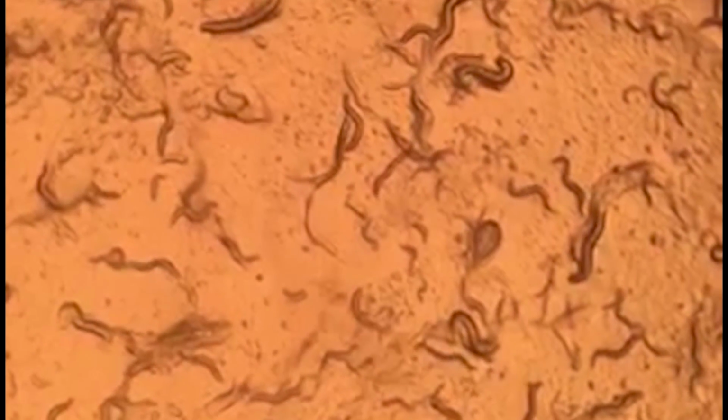Right here, you can see the dumpy mutation is a close, non-fatal variant to the wild type. They're shorter, fatter, and slower, but the defects won't cause any injury or fatality. You can see the movement type is a little different because they're inhibited by their shortness and fatness, which causes them to move slower and not efficiently.